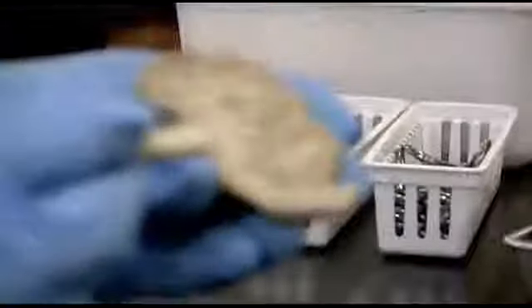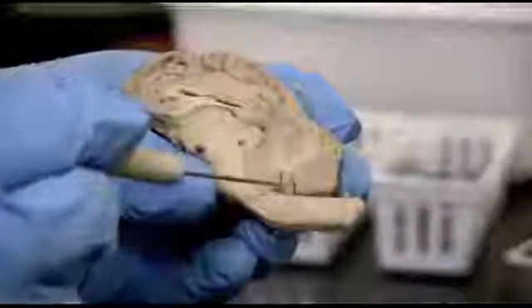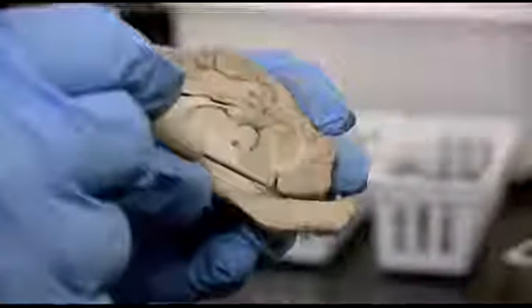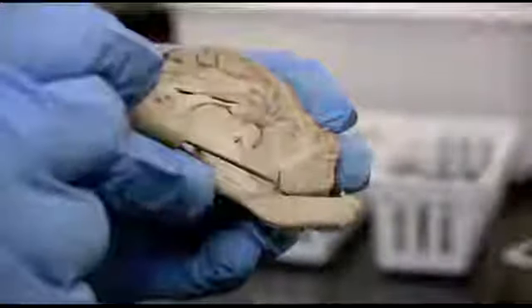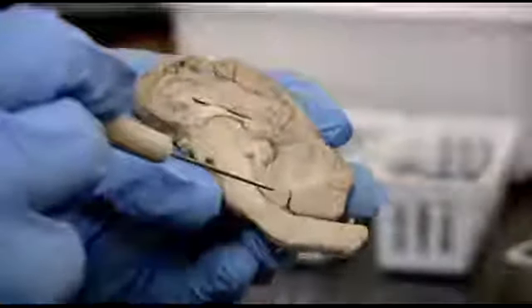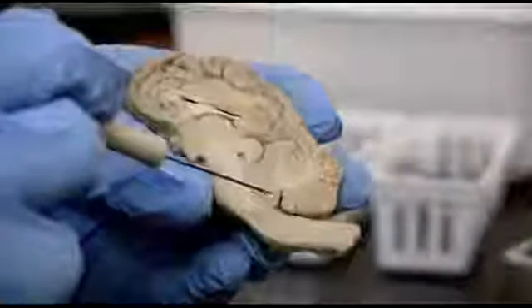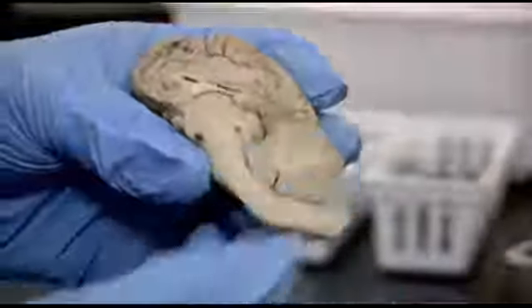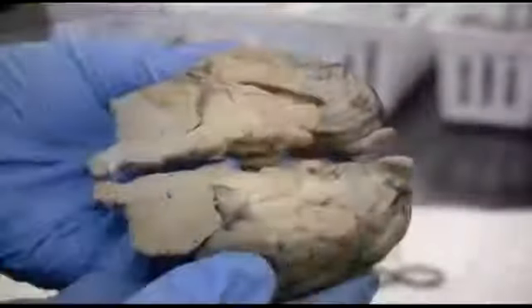So the folia. And then right around that area where the fourth ventricle was located, this would be the flocculonodular lobe, if you remember that word. And that's going to have an important function for pathways that we'll see maintaining equilibrium and balance, which we know the cerebellum is responsible for.